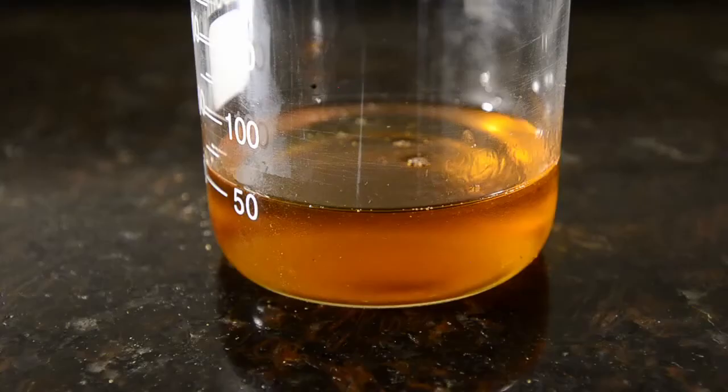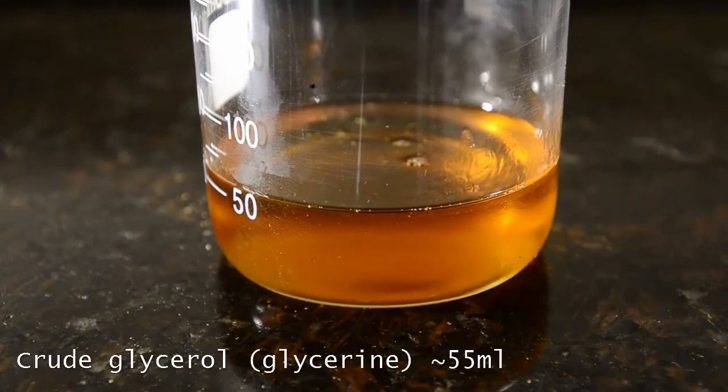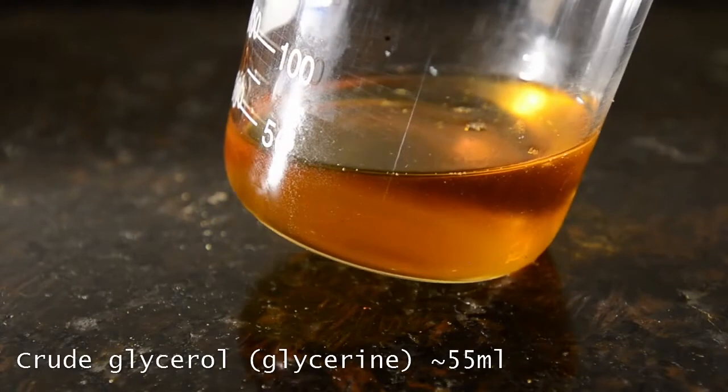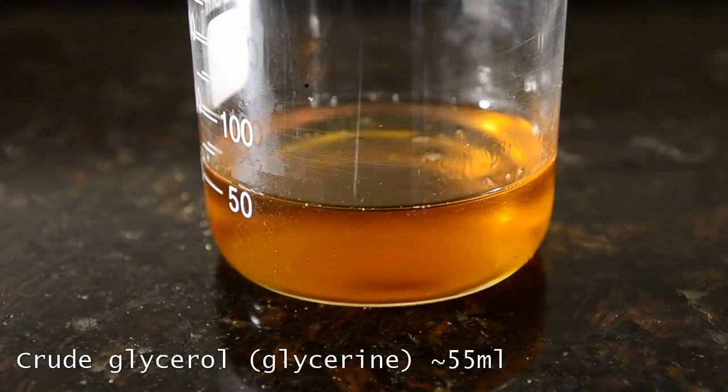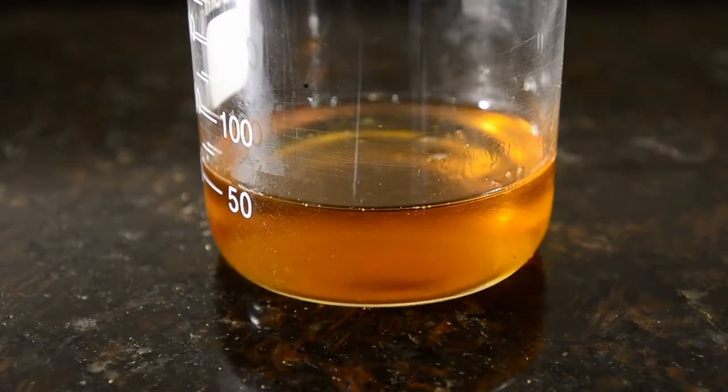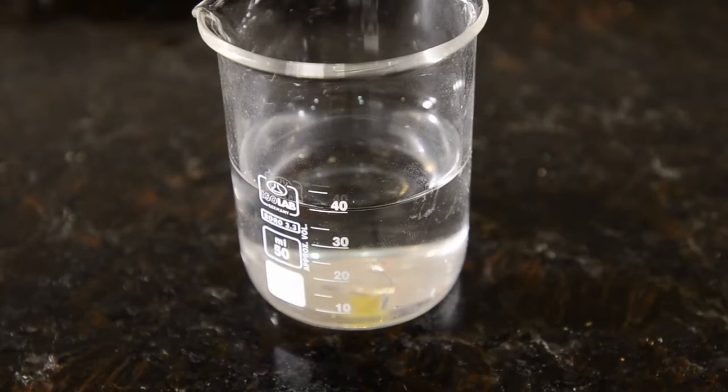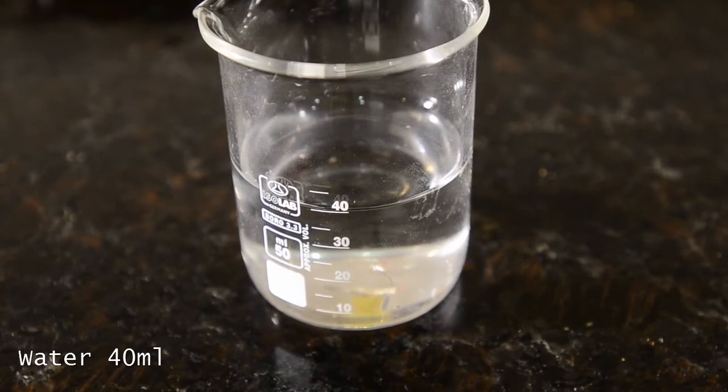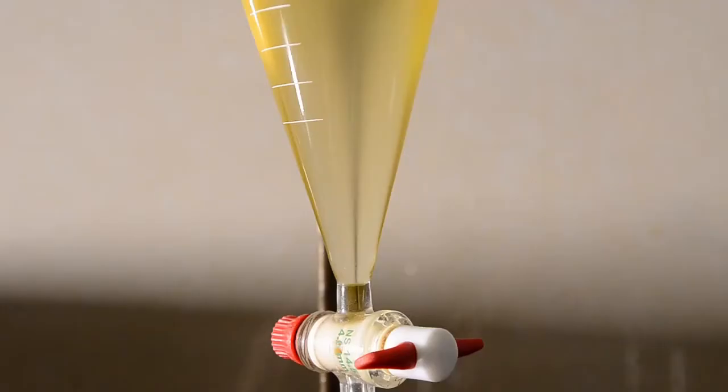If you want to use the glycerin for another purpose then we suggest purifying it first. Our target however is the fatty acid ester product, so we'll discard this. We want to create a lab quality product so we'll first wash the ester with a small amount of water to remove glycerol, methanol, and any sodium salts present.